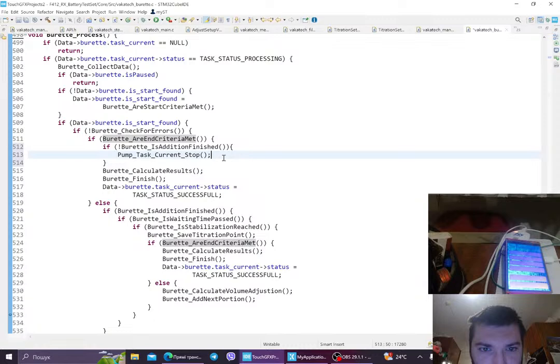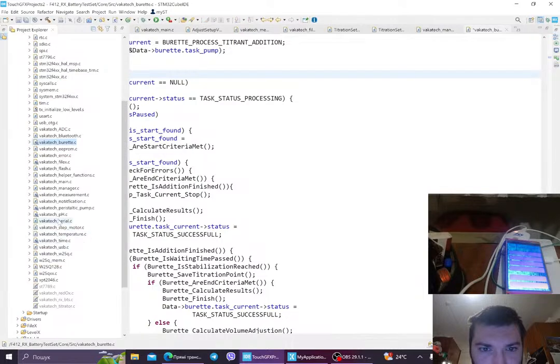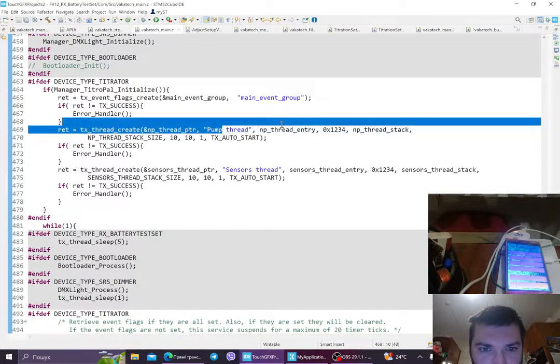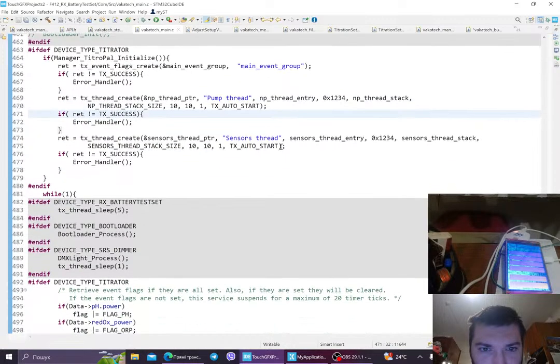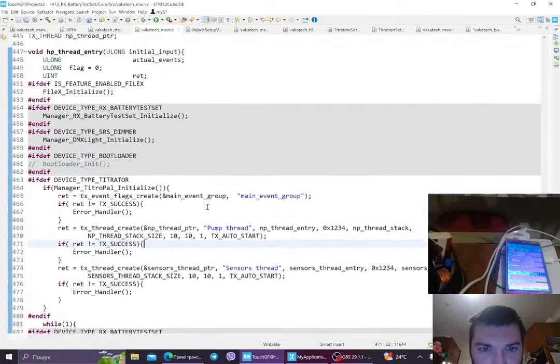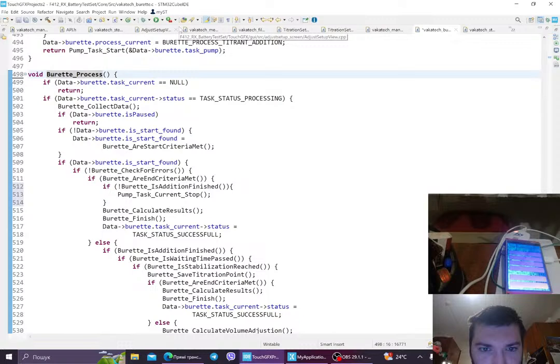You know, guys, this loop is going on in the Wakatek main function. Again, here we have a lot of threads, and I'm using Azure RTOS. This is a very sophisticated operating system, but it gives you really good control, like all of the flags and mutex access and semaphores, and I'm finding a good use for all of it. Yeah, so what's next?